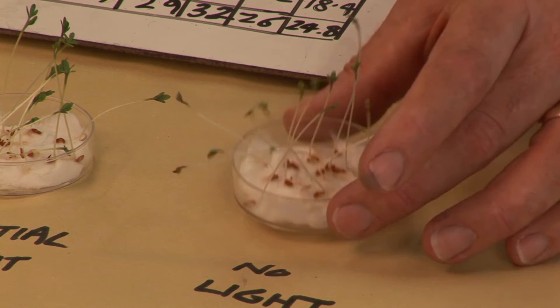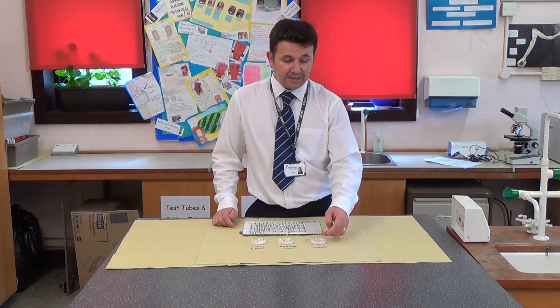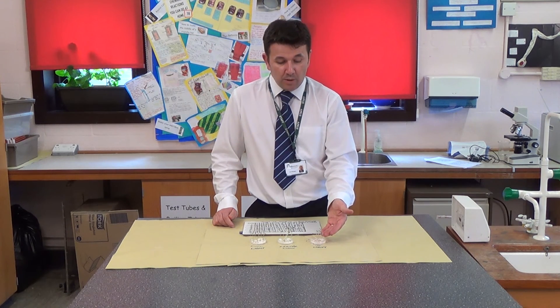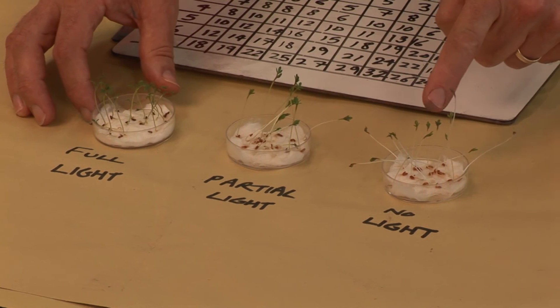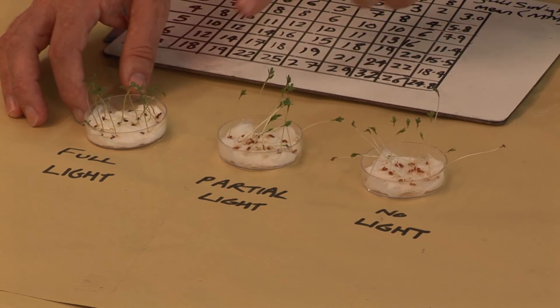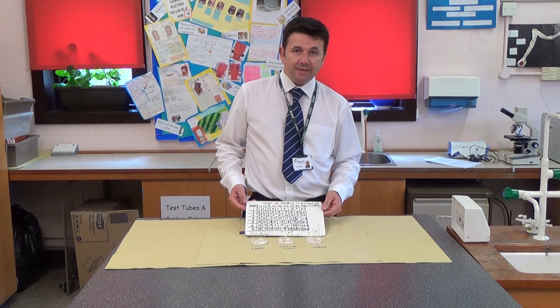If left for another seven days in the dark, these would die — they can't photosynthesize because there's no light, and they would have run out of stored energy from the seed. This is why germinating seeds grow taller without light initially. You can also see a difference in the health of the seeds: the ones in the dark are very elongated and stretched out, with leaves not as well defined as those in the light. This can be done with mustard seed, cress seeds, or any type of seed really, and you can get some really nice results. That is the end of this practical.